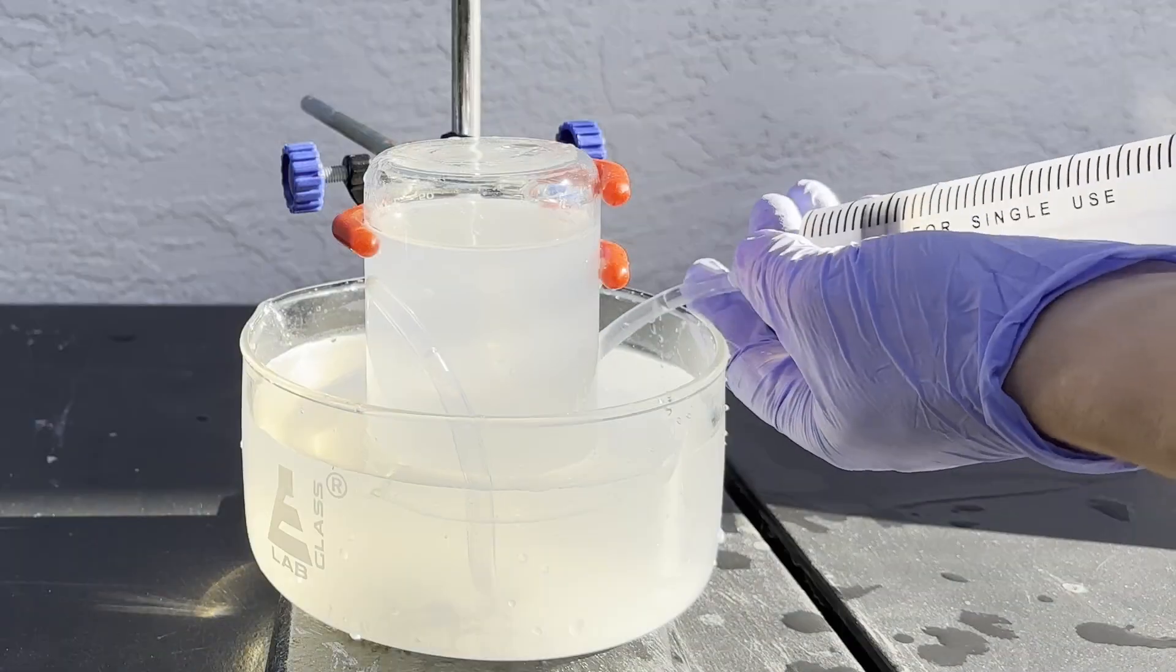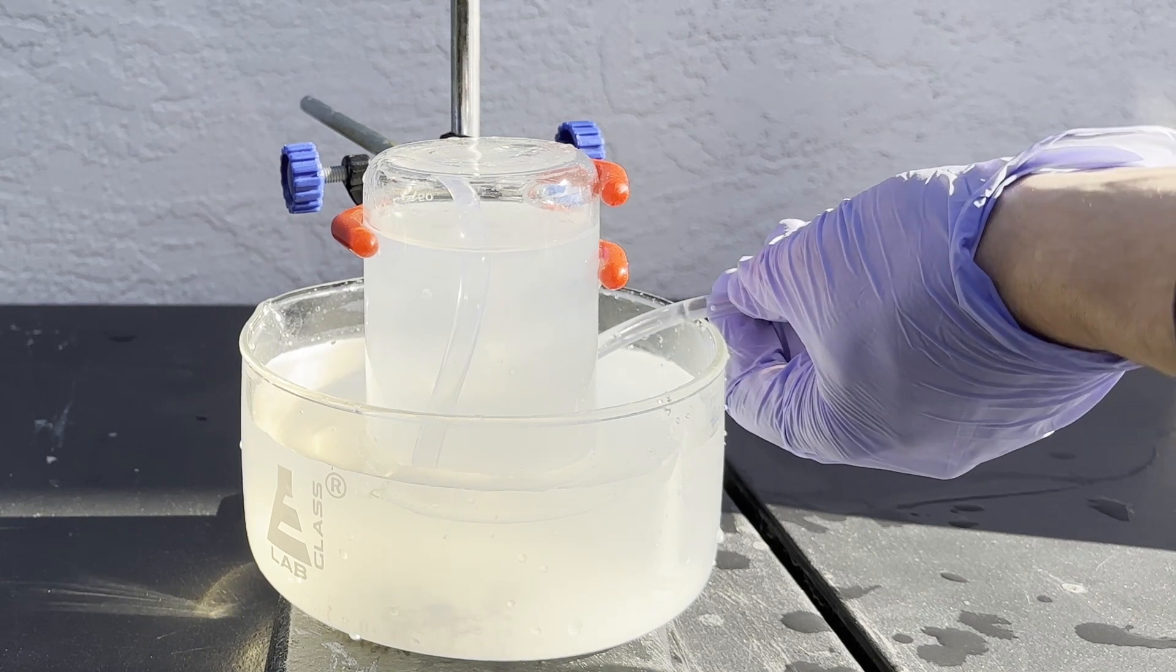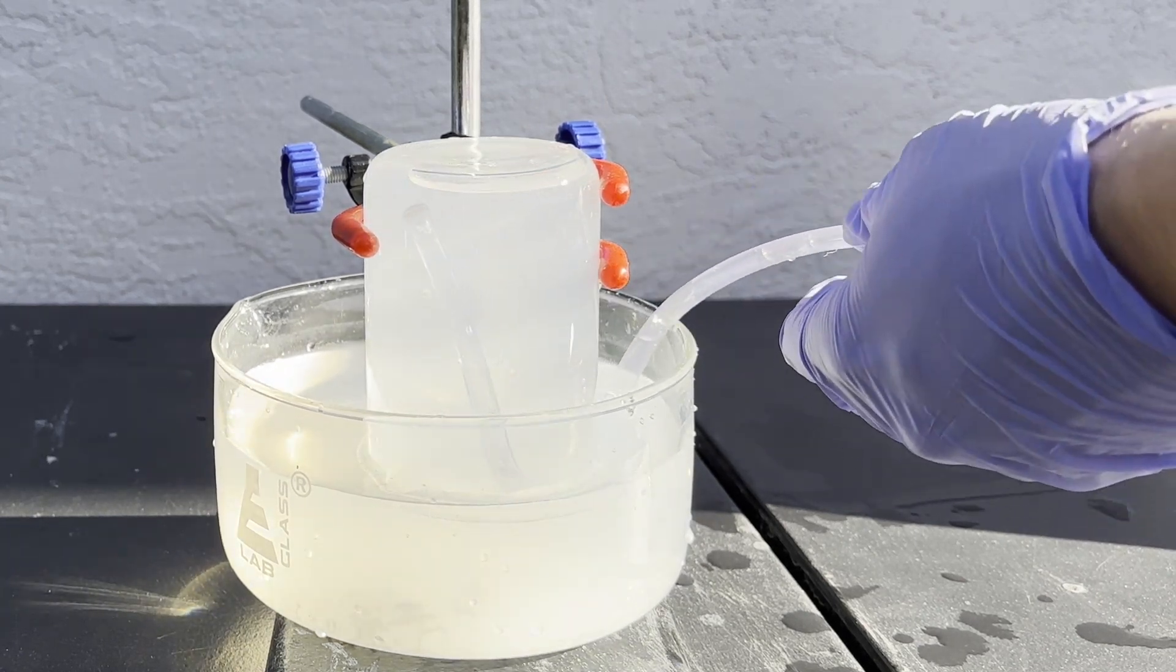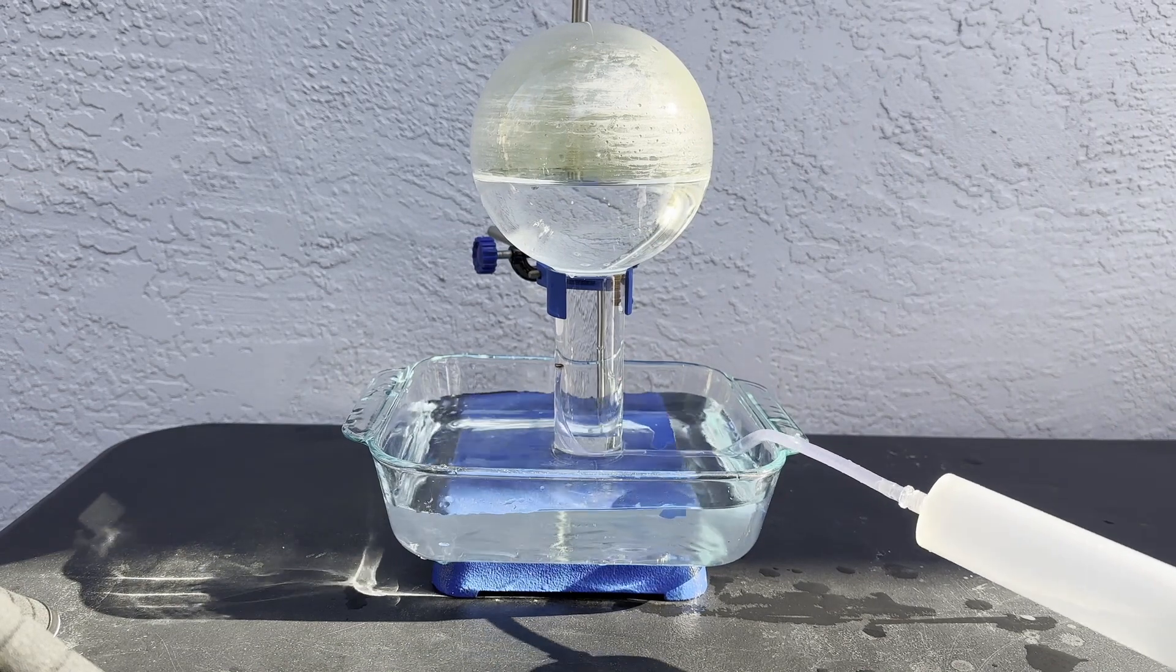But now I have a good amount of reasonably pure acetylene, so I'll draw it into a syringe. With everything ready, now for the moment of truth where I bubble it into the flask of chlorine.